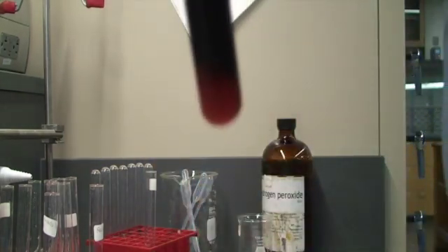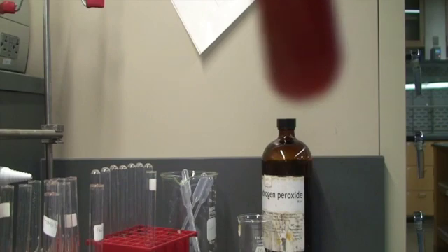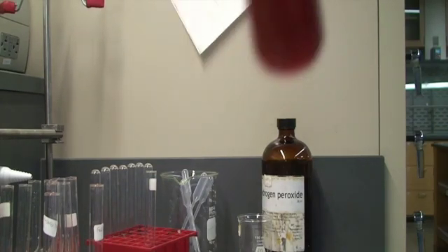Let's try to add some more and see if we can get some more change. Definitely lightened up quite a bit — it's getting a little lighter at the bottom. It looks like there's a precipitate sitting at the bottom. Let's try adding some more NaOH. It's going from a dark blue to a deep rusty orange color, and there's a little bit of a precipitate there. The dark blue color is going away.